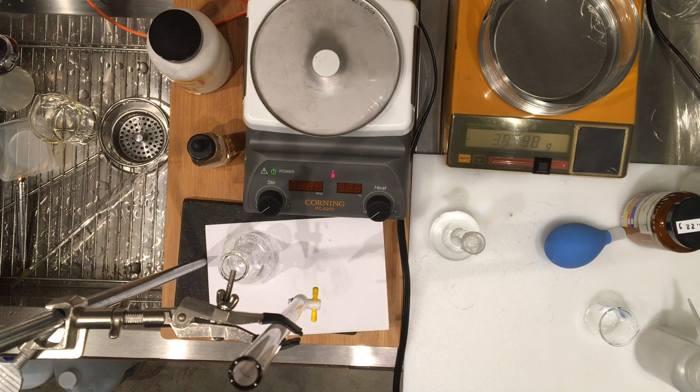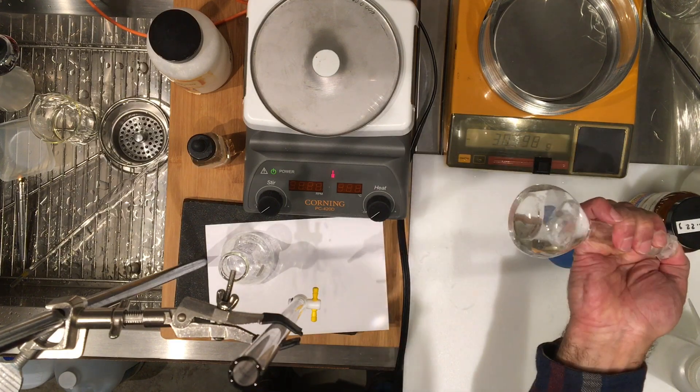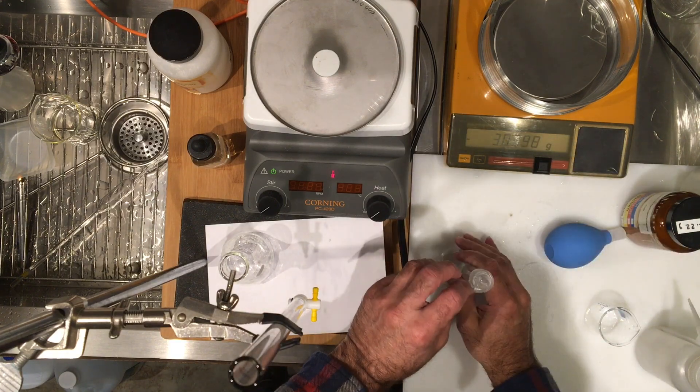So please record that. 20 ml of vinegar diluted to 100.0 milliliter volume, it's actually 20.00 ml of vinegar diluted to 100.0 milliliter, so there it is.